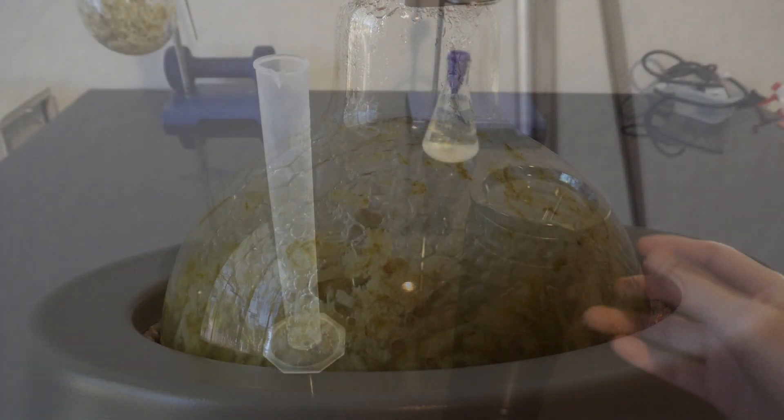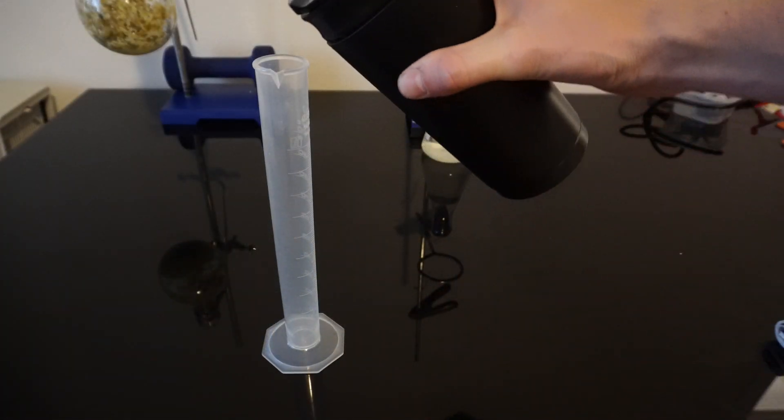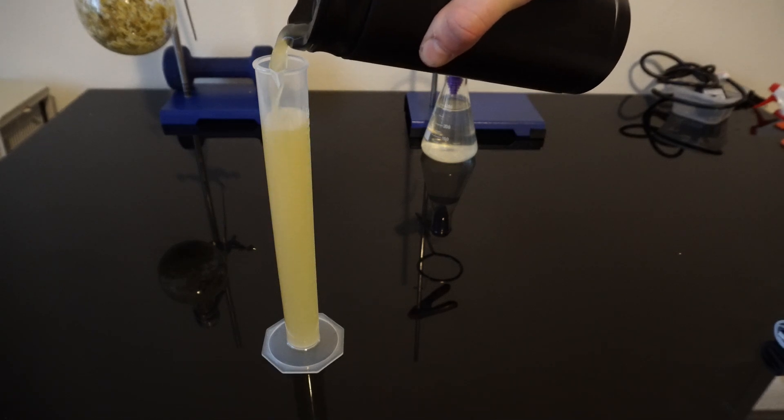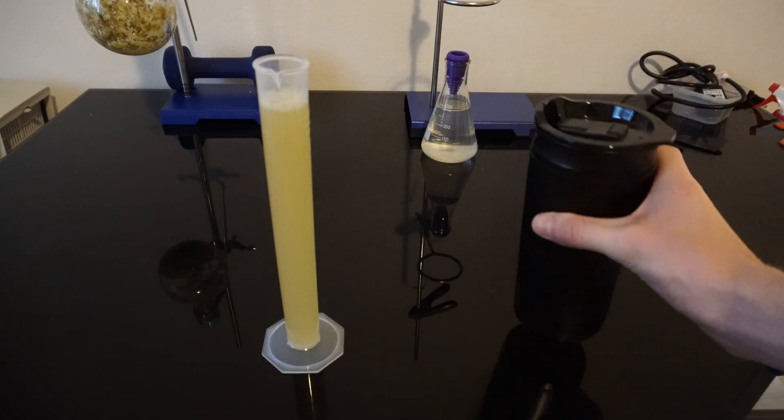I strain out what is in the boiling flask to collect the remaining hydrosol from the mixture. I then collect about 80ml of the hydrosol and store it for future use.